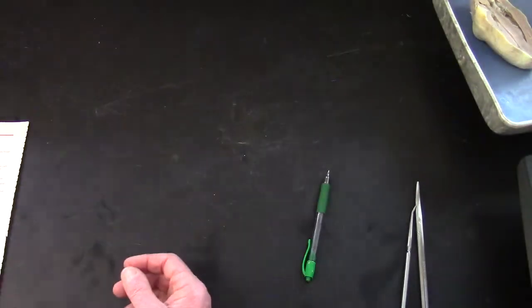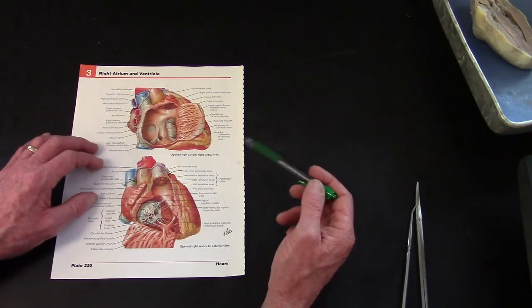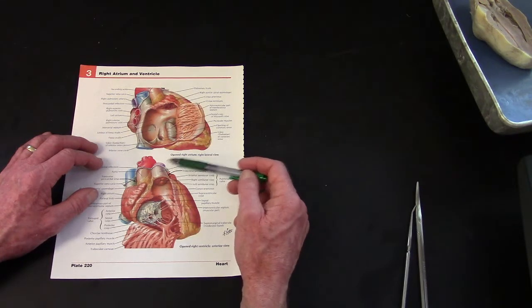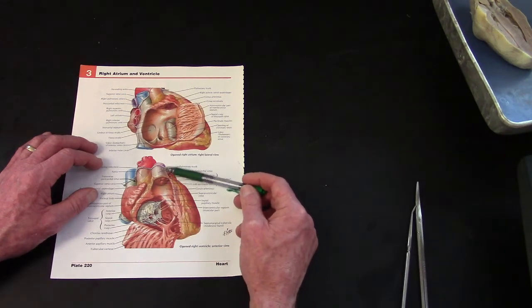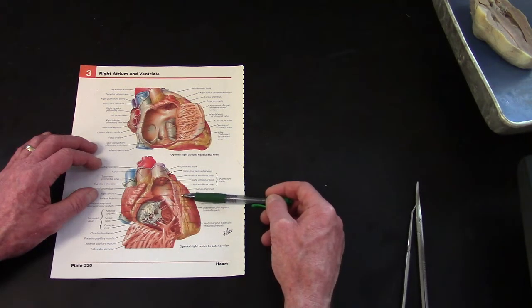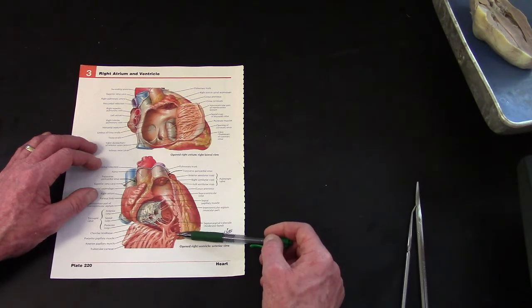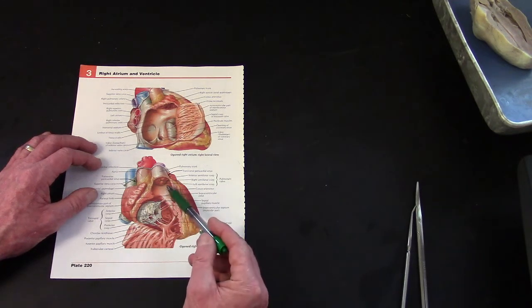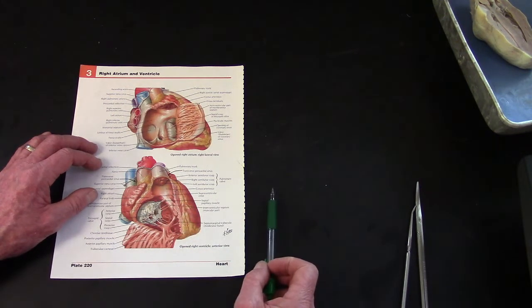A different view, and this is what I hope to show on the video. Here's the heart, and what I'm going to do is start with the right ventricle, and we're going to find the pulmonary trunk. That's the landmark. It's easy to find, and we will cut down through the pulmonary trunk, and we'll go right along the septum between the right and left ventricle. We'll cut this. It's fairly thin, and then we will reflect this wall like a window and look in and see the right ventricle and the valve. So that's the plan.